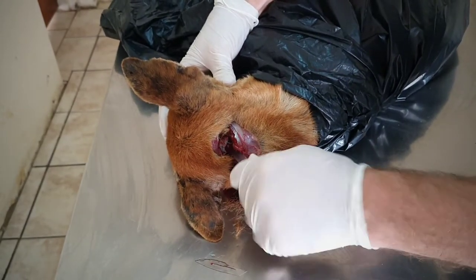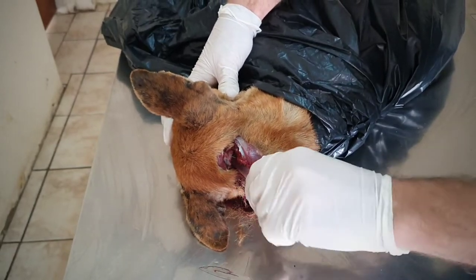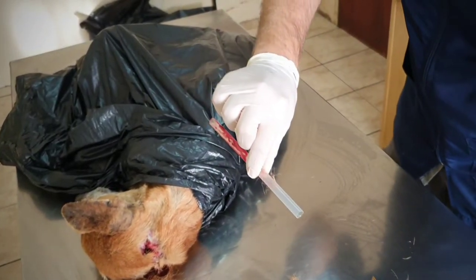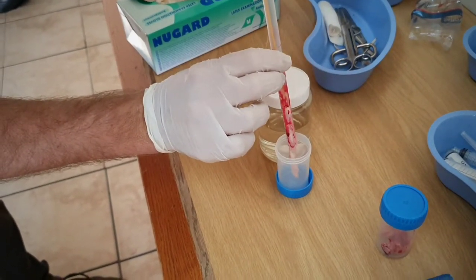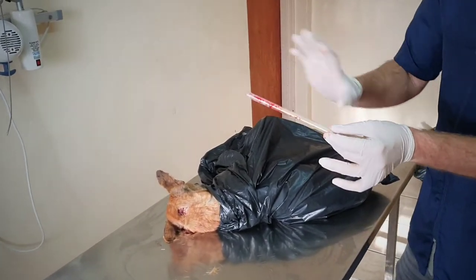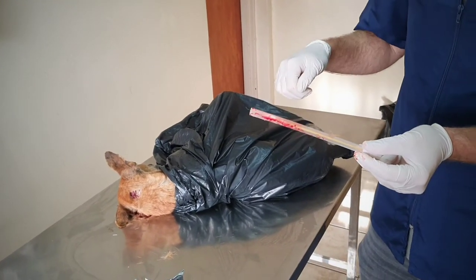Give it a good twist once you get to the front to make sure that you separate all the tissue that you're removing. Lock the back, pull it out — there's your sample. We have flushed them out the back before with glycerosaline but usually they can slide out quite nicely. And then dispose of your straw, your gloves, your scalpel blade — everything safely from there. Take off your protective clothing, put it into the appropriate biohazard disposal.